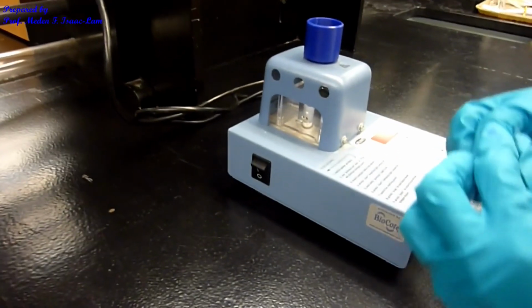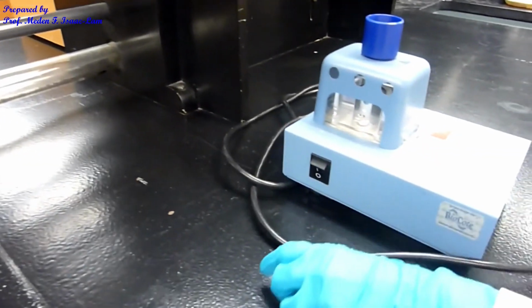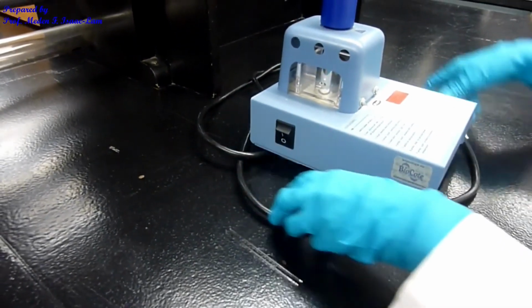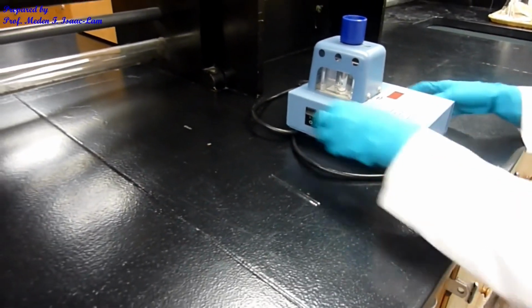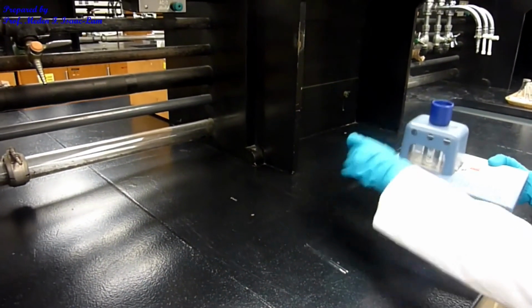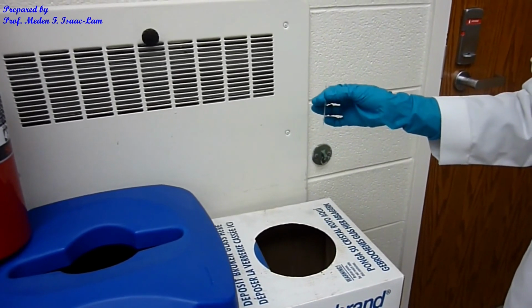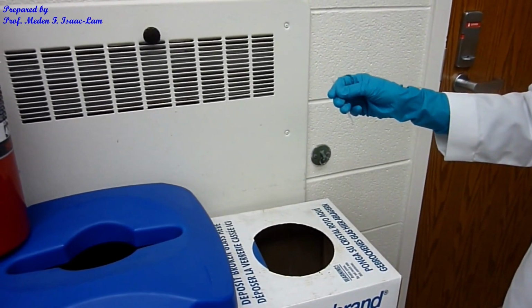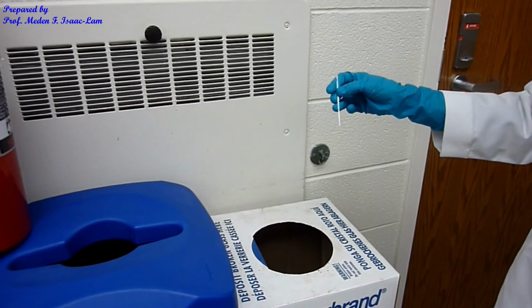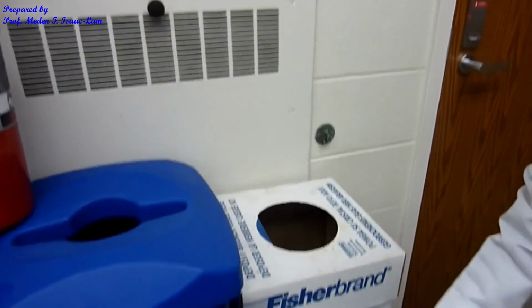All right, so I unplug it. Typically when you are using this equipment, you have to put it back where you took it. It's typically on top of the bench, and make sure that everything is off. So to discard this, I'm still showing you guys even though we're not doing this face to face. So this one is the glass tubing, it goes to the glass waste. Okay?